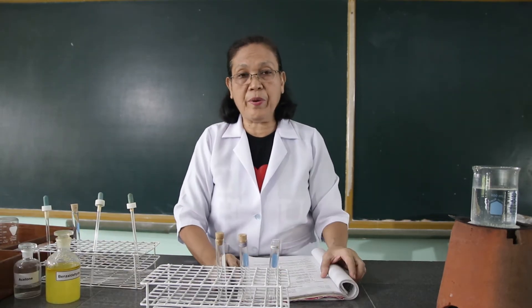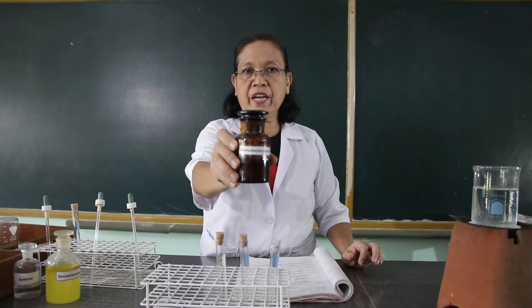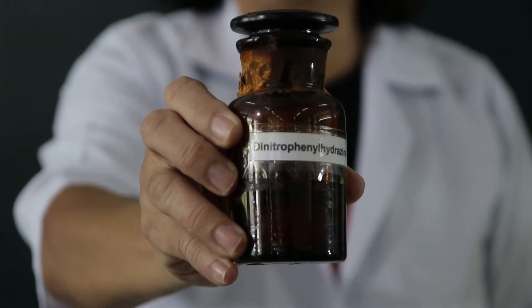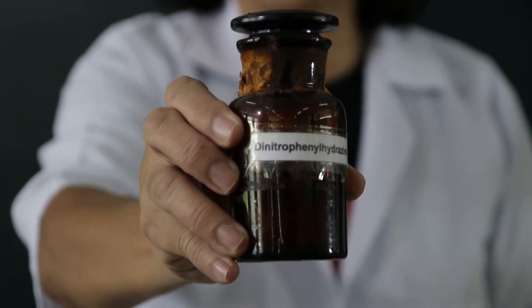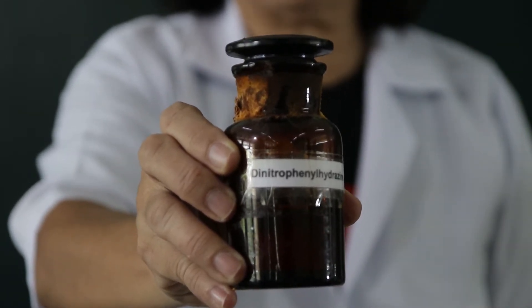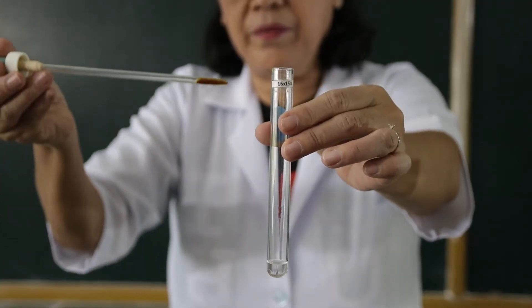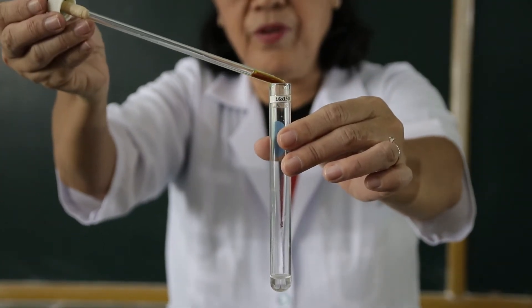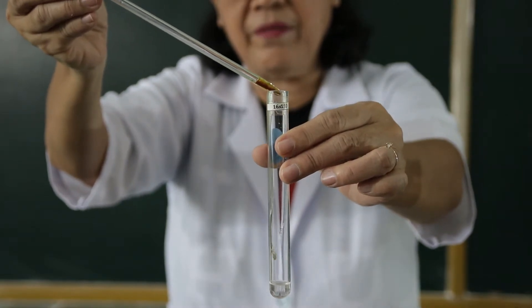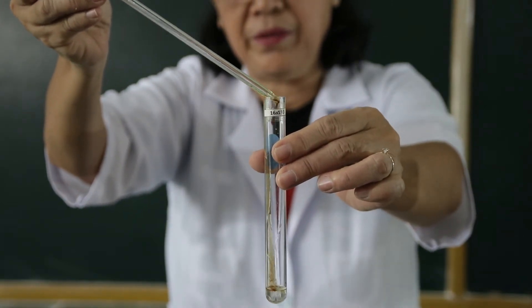Then, to these test tubes, we are going to drop the 2,4-dinitrophenylhydrazine. This is the 2,4-dinitrophenylhydrazine. I want you to observe when I am going to drop this solution into the aldehydes and the ketones. We are going to drop the 2,4-dinitrophenylhydrazine into the formaldehyde — one, two, three drops.